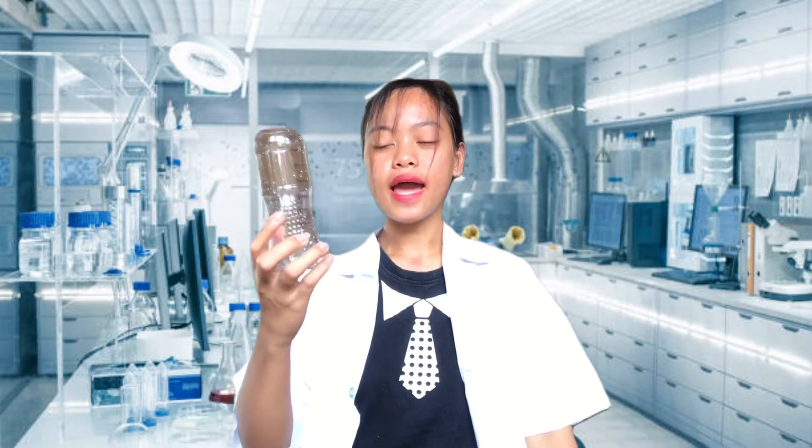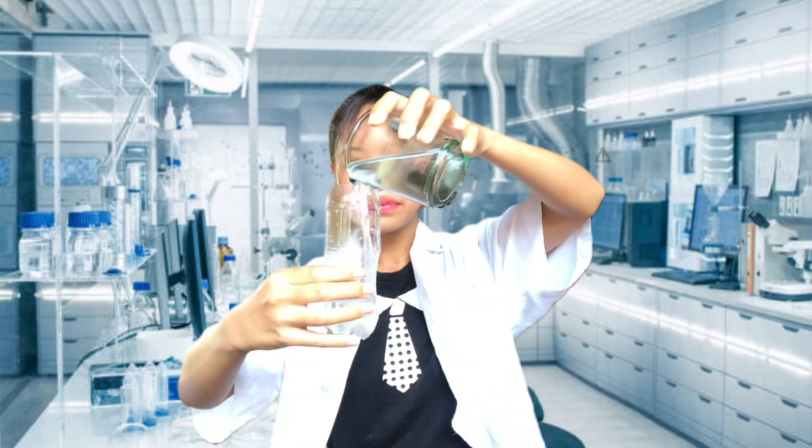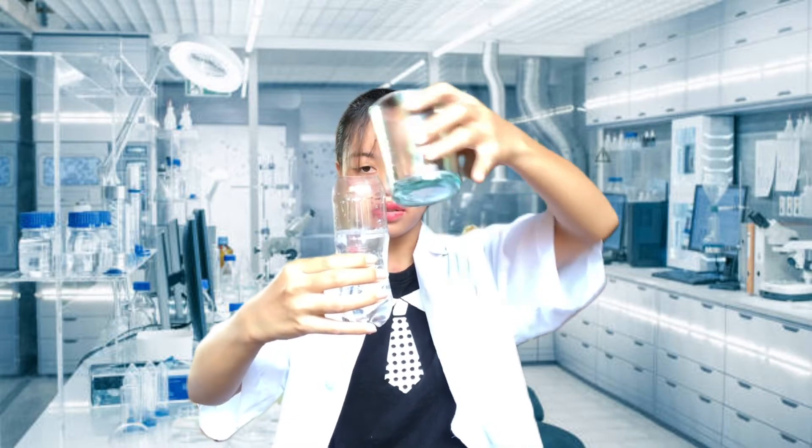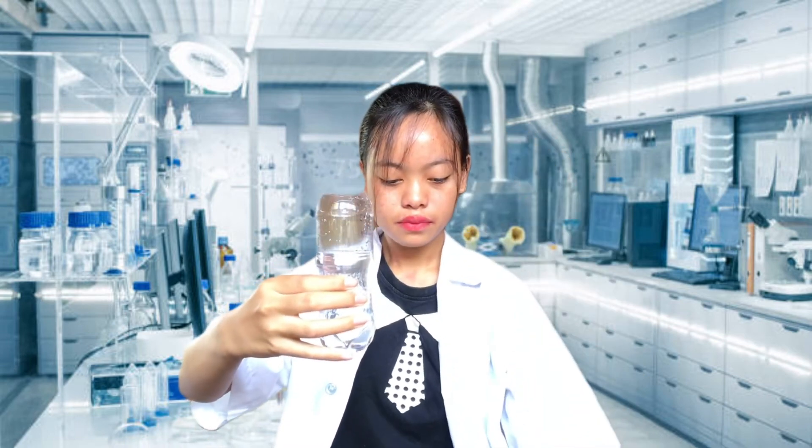Let's say we're going to be measuring 60ml of liquid substance. The first thing to do is the container should be placed at eye level to take a reading. Hold the container with one hand while pouring into another container. Take the liquid that will be needed to measure — the surface of a liquid is called the meniscus. Calculate the volume of a liquid by adding the whole measurement to the sum of the segment.